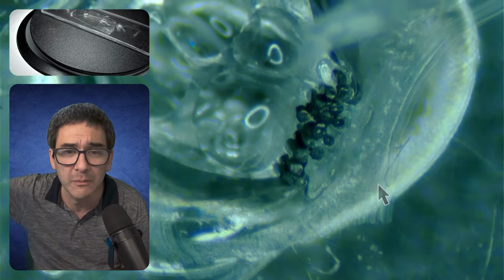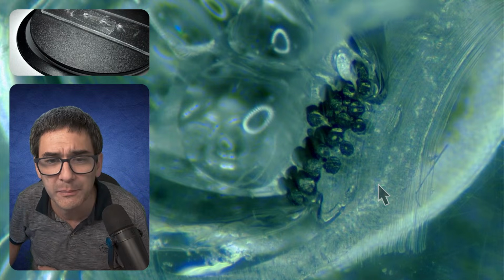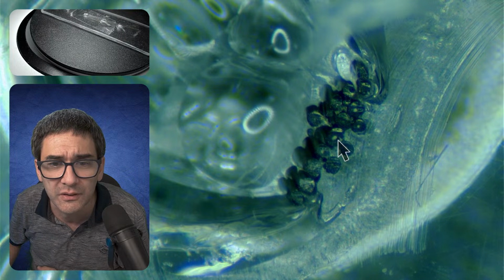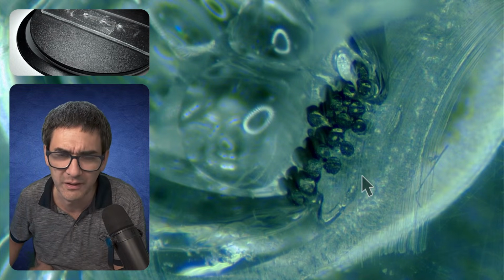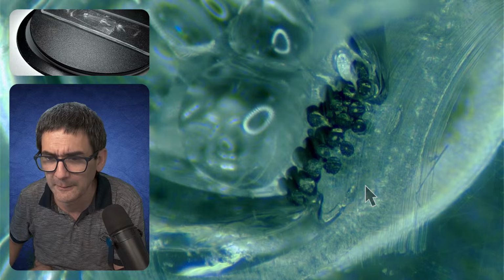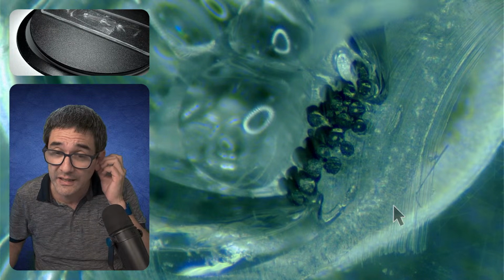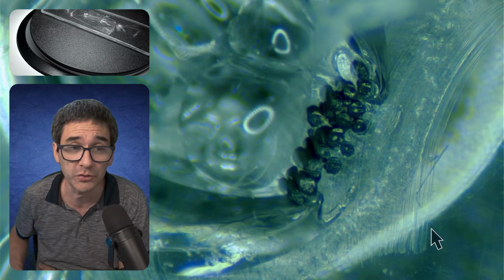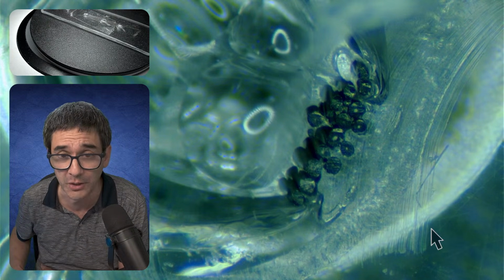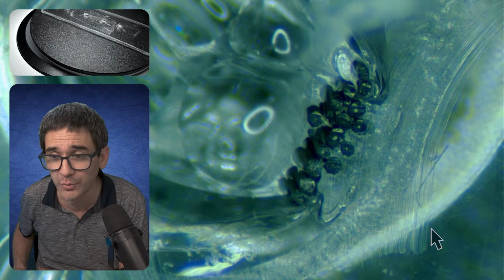Here you might be able to see that some of the hairs are a little bit brighter in the center. So this could be the central bright part, but you see, not good enough. There is a technique on Reddit. I've seen that somebody tried to do that and got way better results. It could also be that the hair is a little bit too dark. So just sharing this with you.